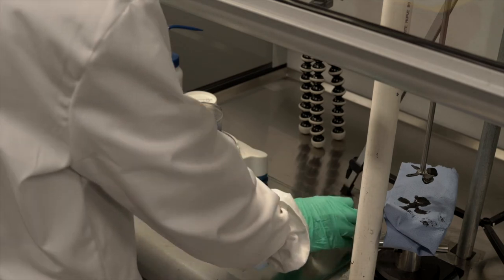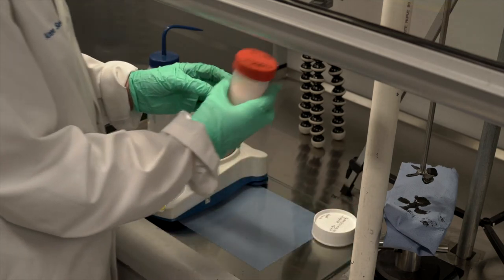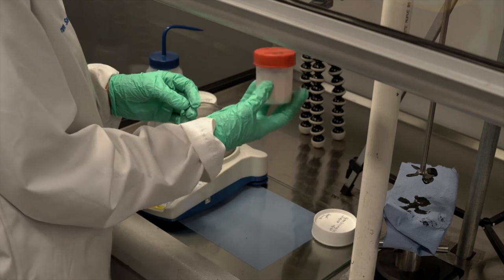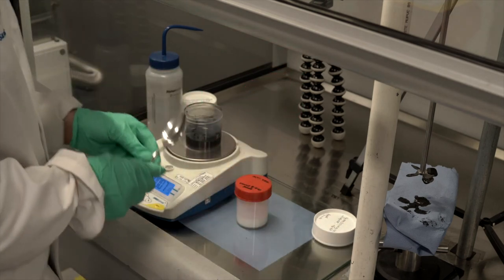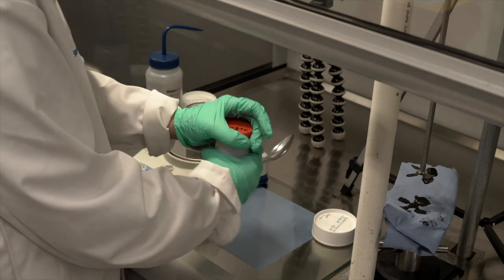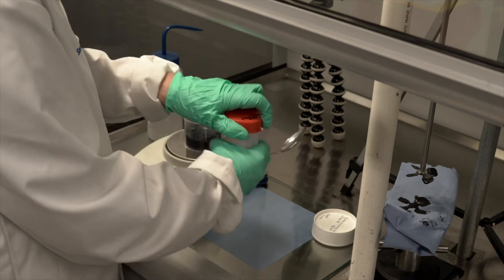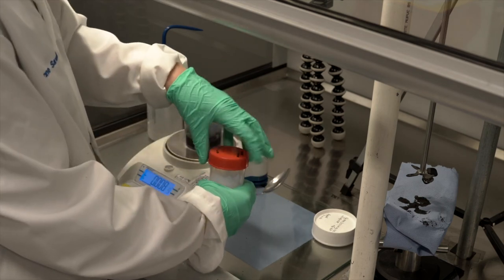It can be difficult to get right on because as a liquid, I can only add it a drop at a time. Sometimes I have to accept slightly more or less. I like to err on the side of slightly more than 0.48 grams.